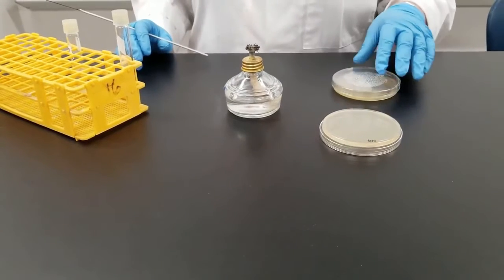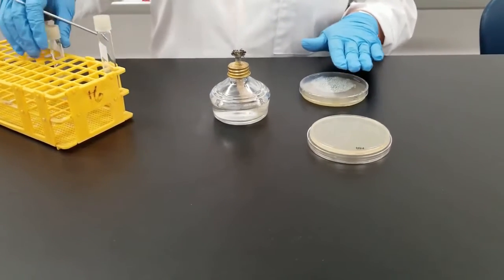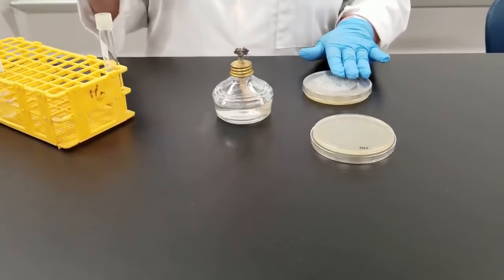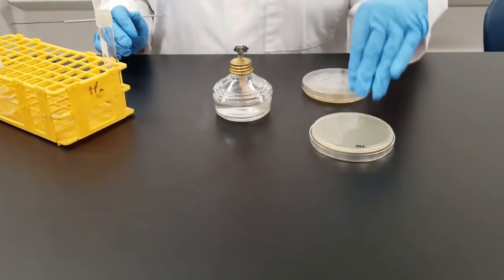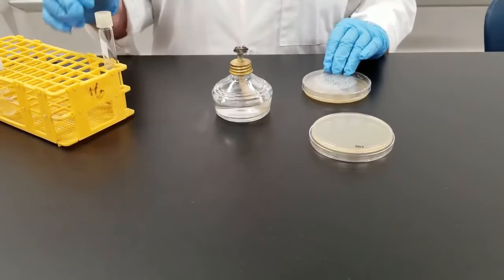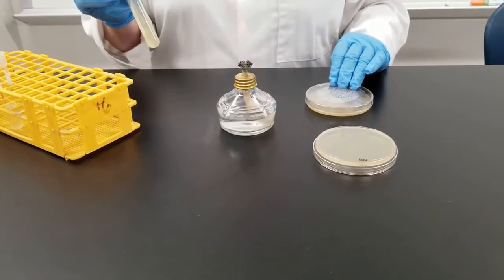Now for today what I'm going to do is we have a stock culture that is growing on this petri dish, and I'm going to show you how to transfer it to another petri dish. So we're going from solid medium to solid medium. And then I'm also going to show you to another solid medium, but that's going to be the slant.